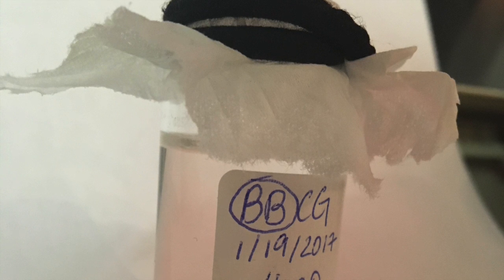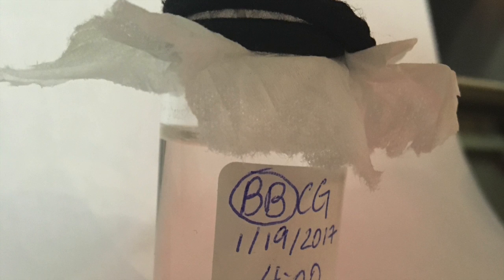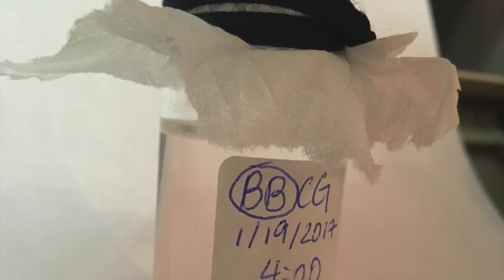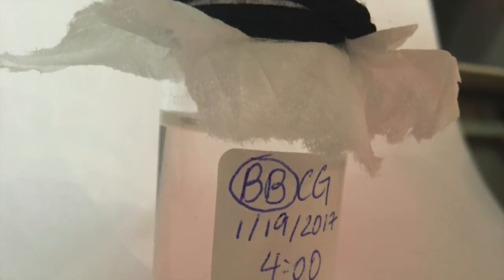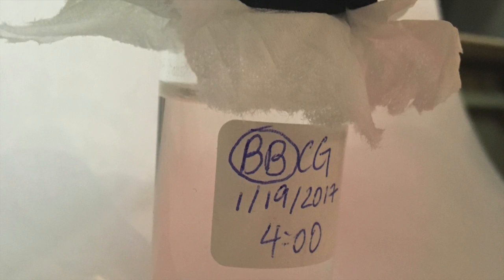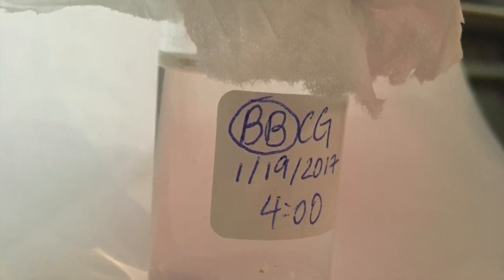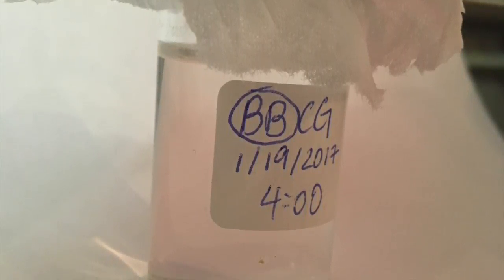Today is January 31st, 2017, 12 days after I filled my vial with saturated alum solution. As you can see, my vial still does not contain crystals. If you look closely, the base of the vial has formed a few objects that look similar to small snowflakes. These objects could be the nucleus of a new crystal, so I'll be able to tell whether or not they are in a few days.